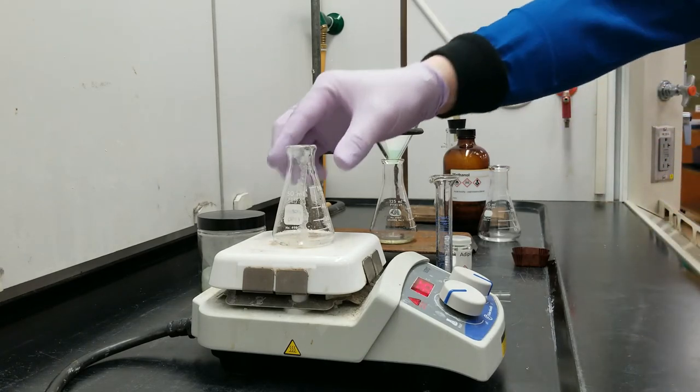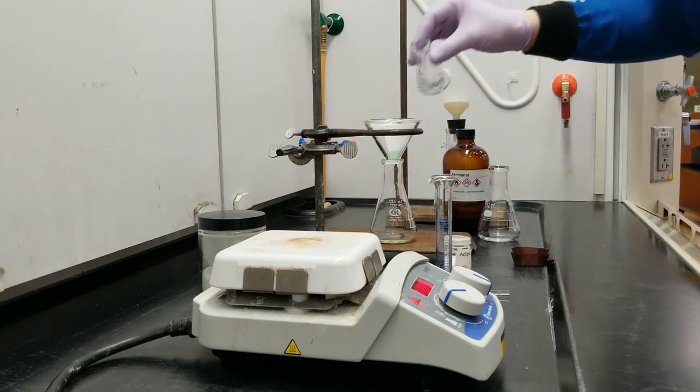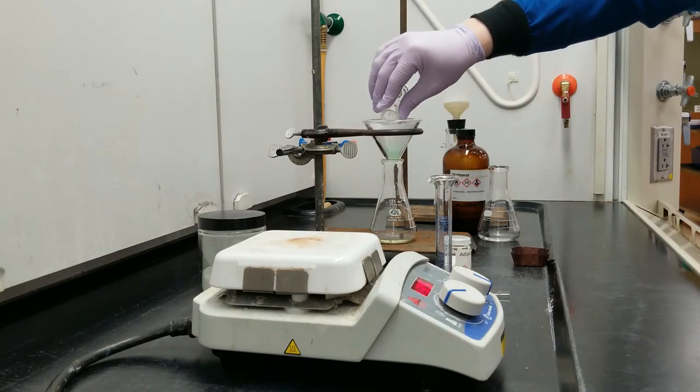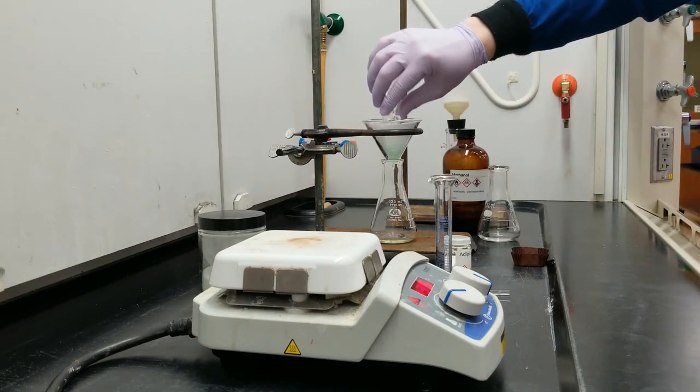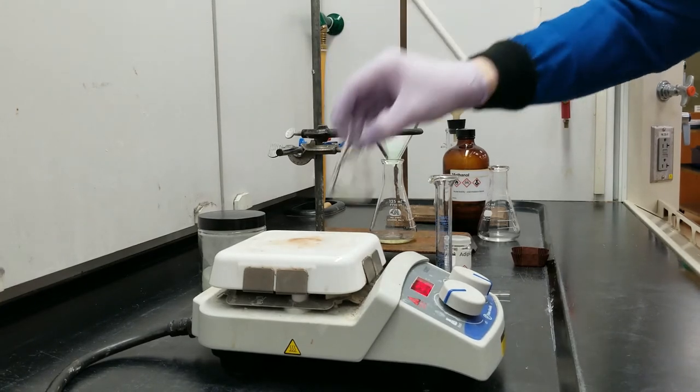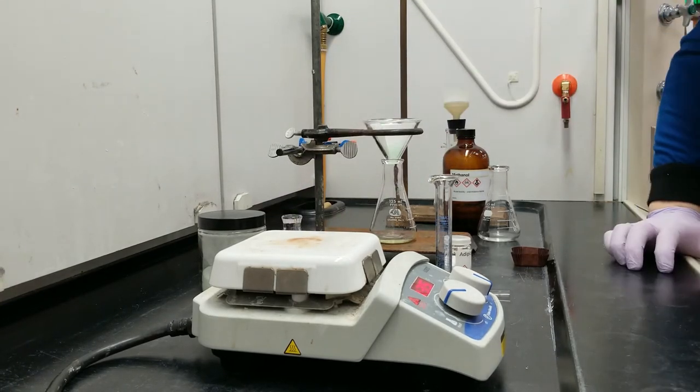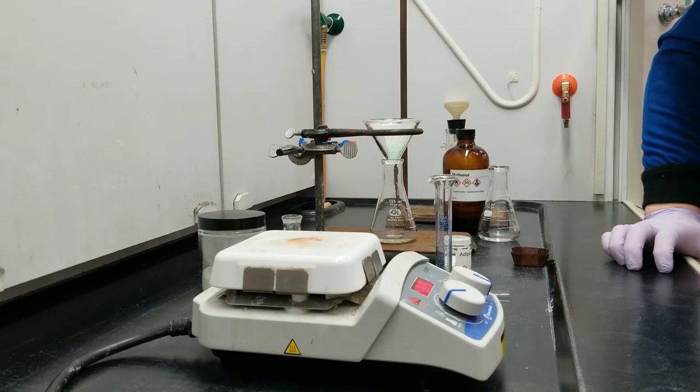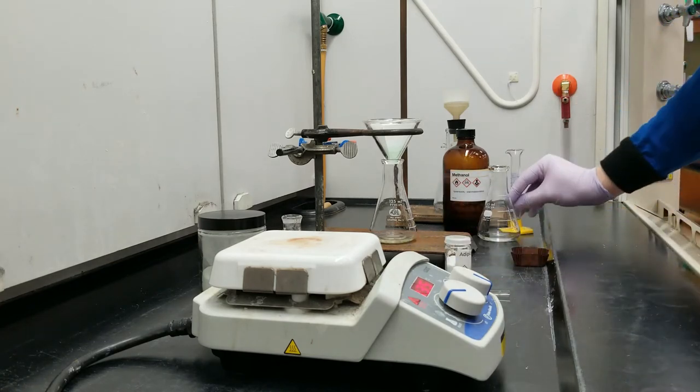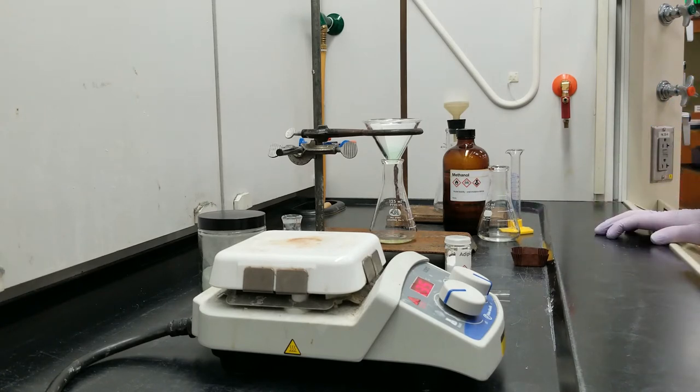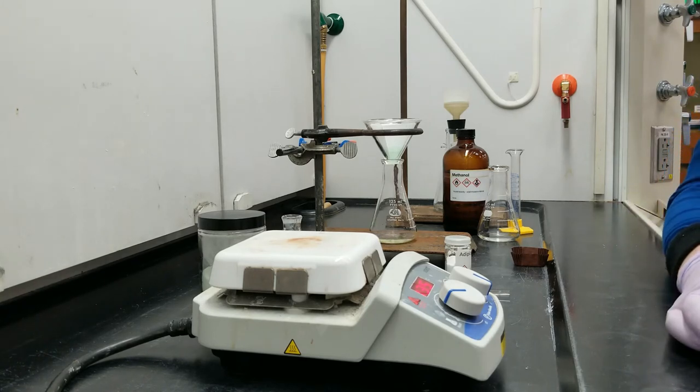And like I said, methanol heats up very quickly. I'm already starting to see some little drops of methanol falling down the sides of this glass. So I'm going to go ahead and run that through my filter as well.